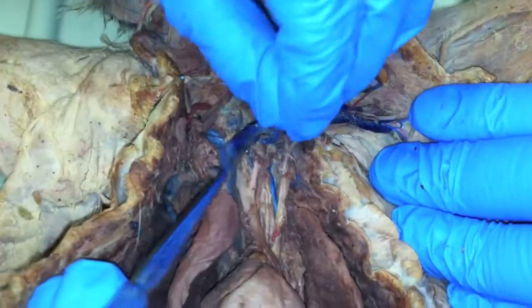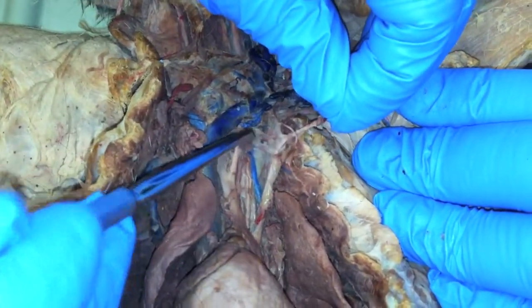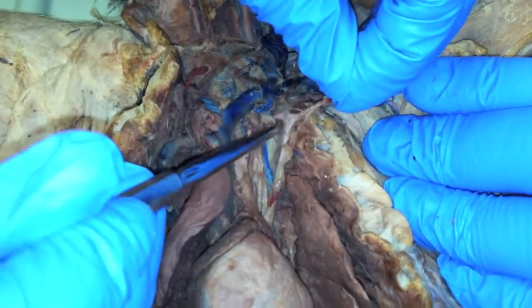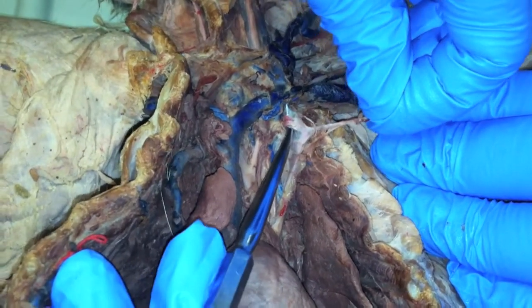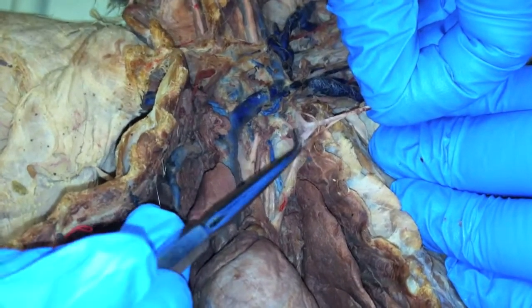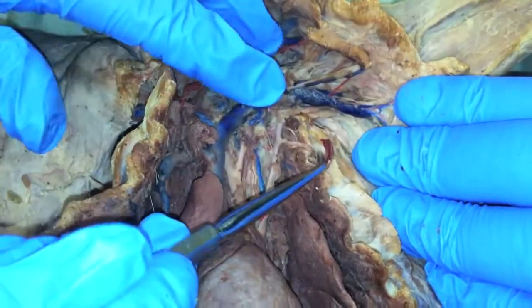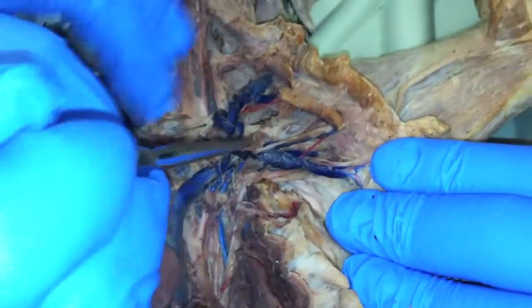Did you guys find one? There's definitely something coming off like right in this area here. There we go. So I'm pulling on it there now. There it is — costocervical. So vertebral, costocervical, internal mammary, and then thyrocervical. Can you follow the thyrocervical up to the transverse scapular?